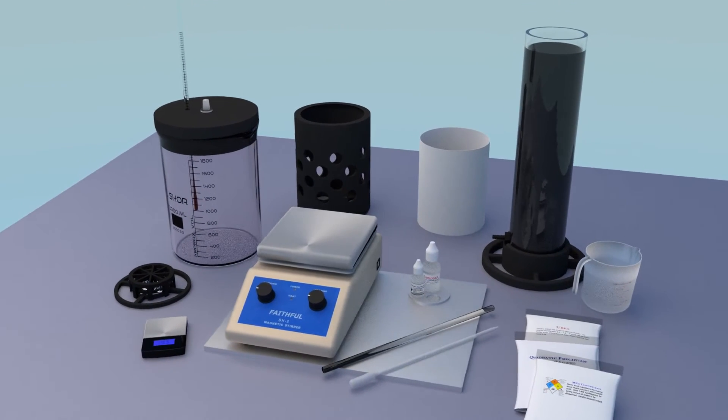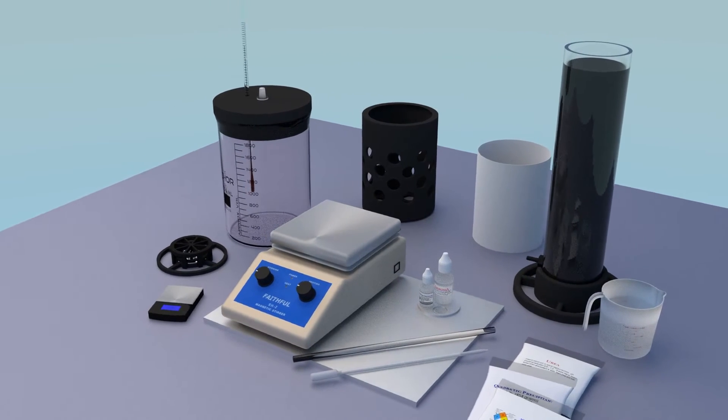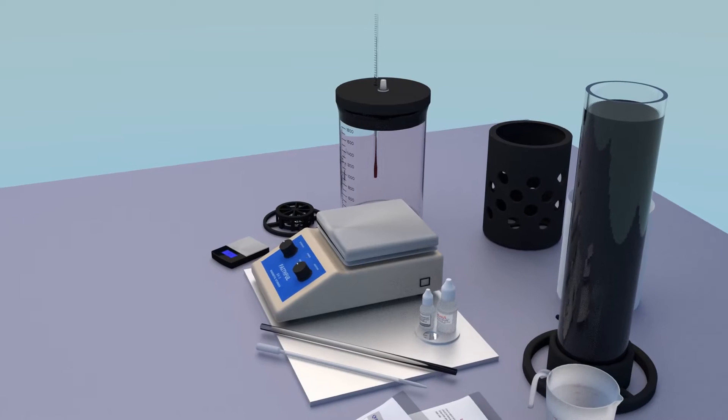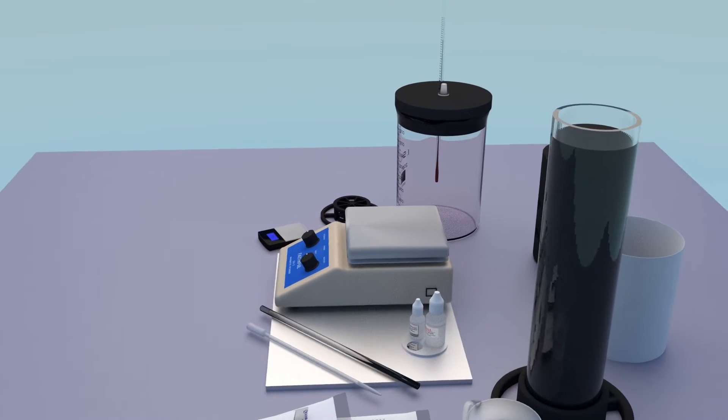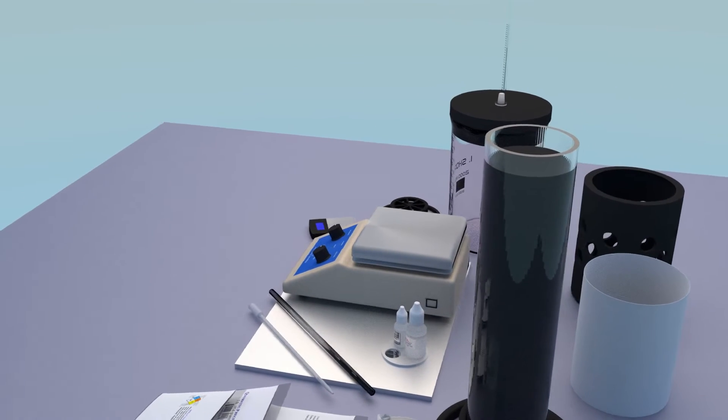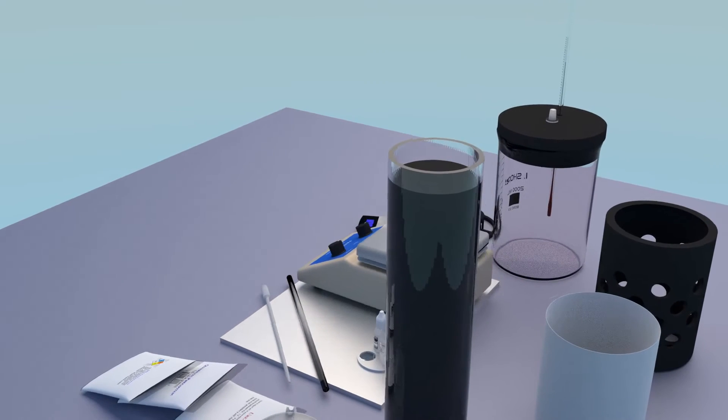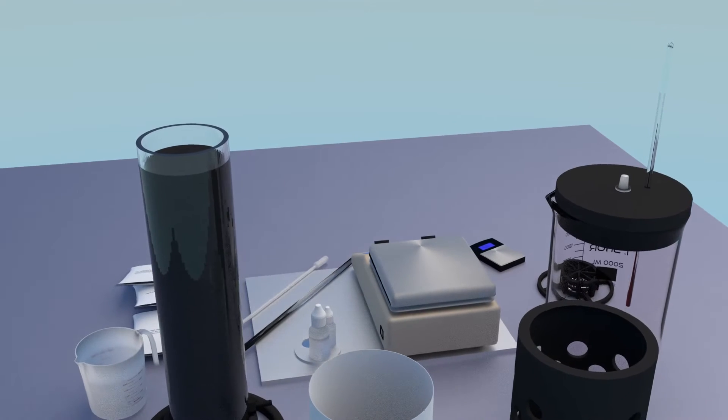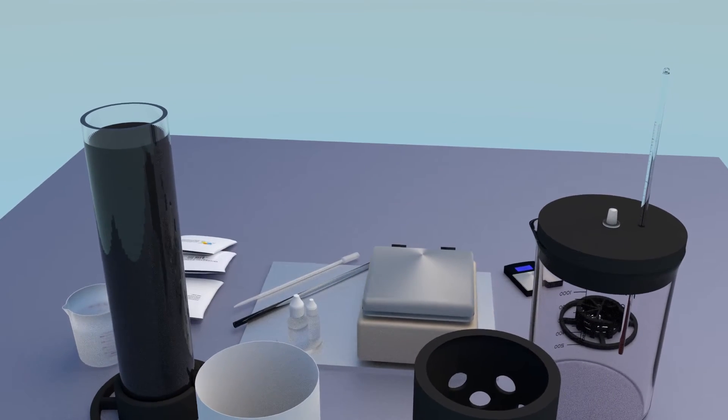Refining in aqua regia is a simple and easy procedure, but like anything new, it can be a little intimidating, especially since you are working with gold. Don't worry.